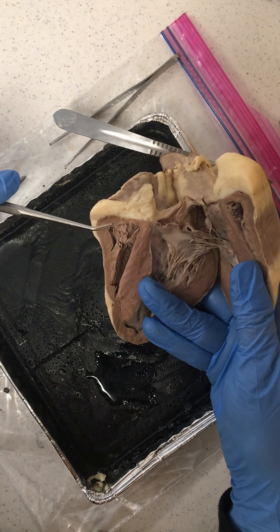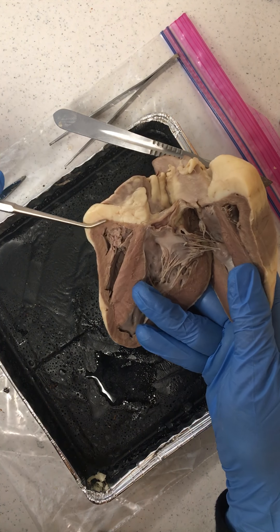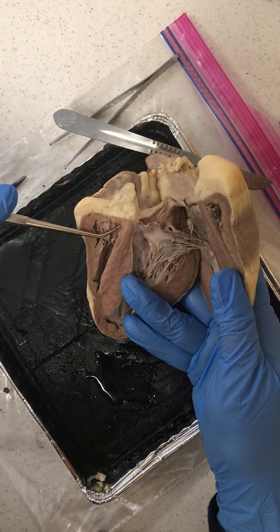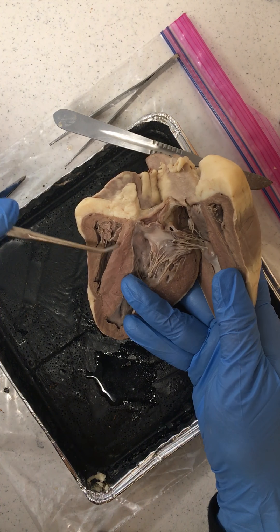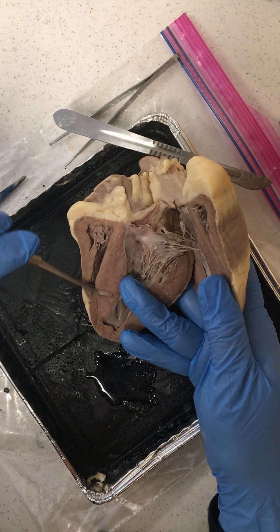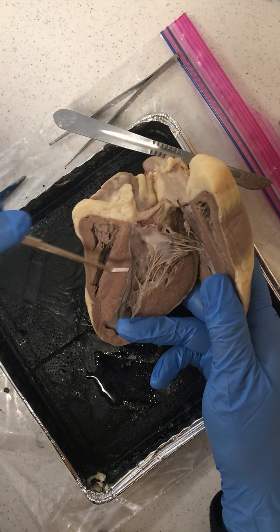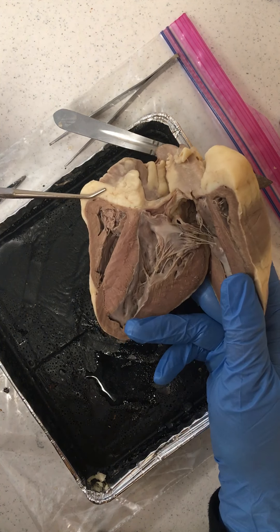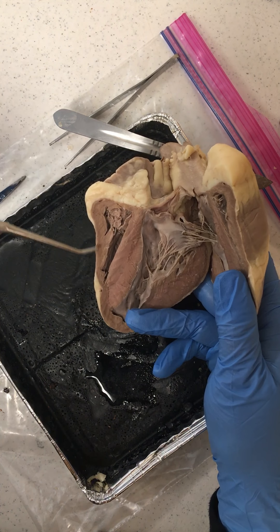Here we have the SA node in the atria, which is our heart's pacemaker. That backup pacemaker is the AV node, which then forms the AV bundle or the bundle of His. We also have in this wall the left and right bundle branches that form down here into the Purkinje fibers.